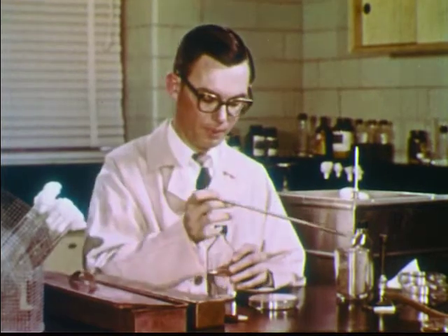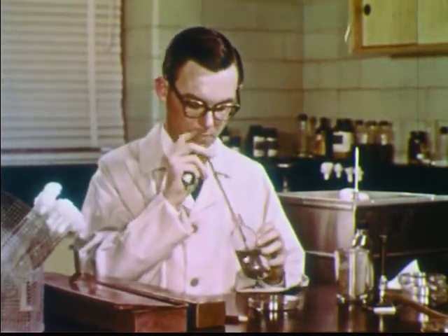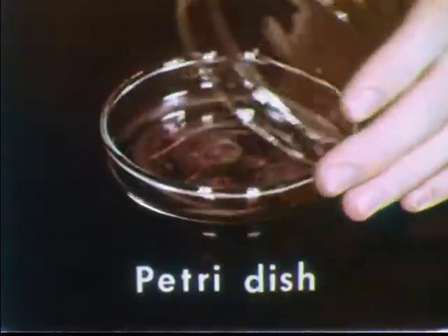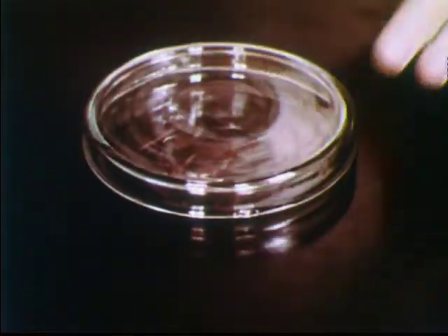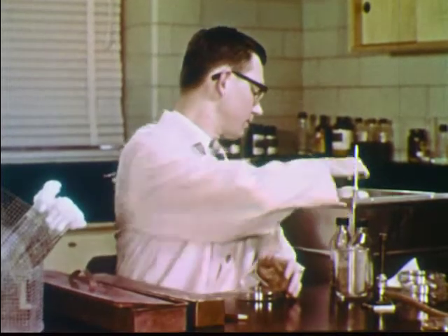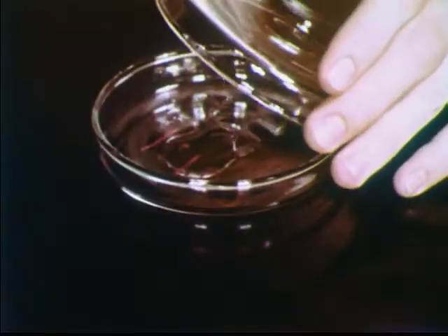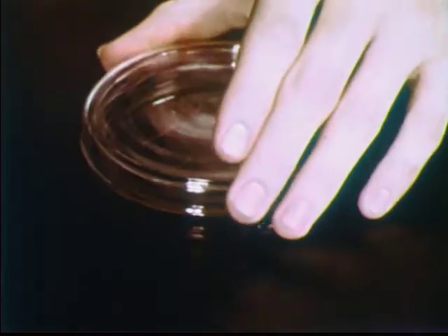For example, to grow the bacteria present in soil, a small sample of soil is mixed with sterile water. Then some of the mixture is transferred into a sterile petri dish, a special plate used for cultivating bacteria. The lip of a tube containing growth material is heated in a flame, then the contents are added carefully to the diluted soil sample and mixed gently.